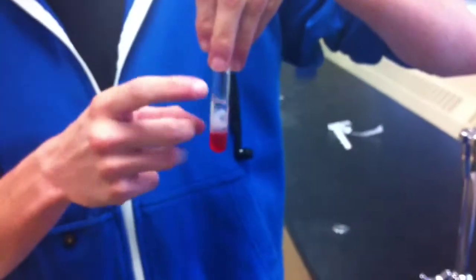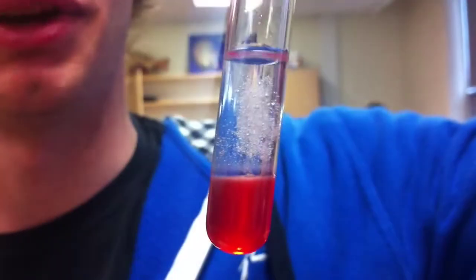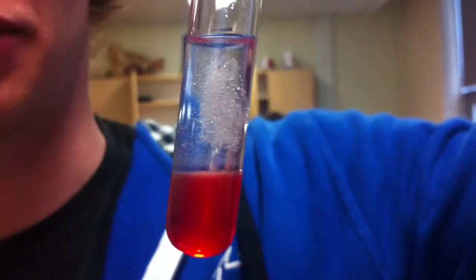Let's fully separate the DNA. As you can see, the DNA has separated from the strawberry mixture and has precipitated into the ethanol. We are now going to extract the DNA and centrifuge it.